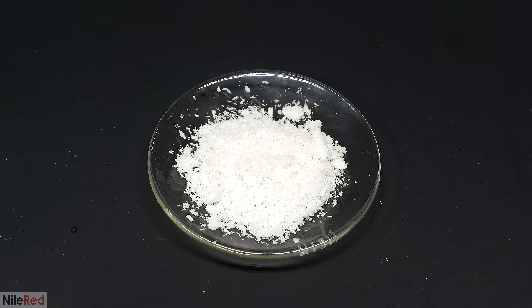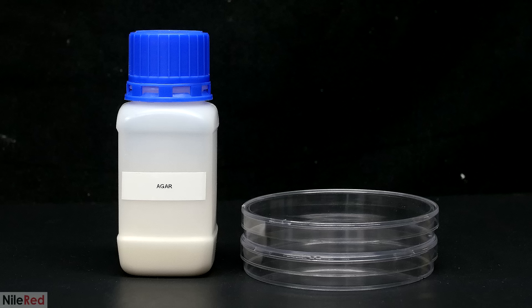Now I'd like to move on and test the antibacterial and antifungal properties of the chlorobutanol. To do this, I just have to set up some simple agar petri dishes.